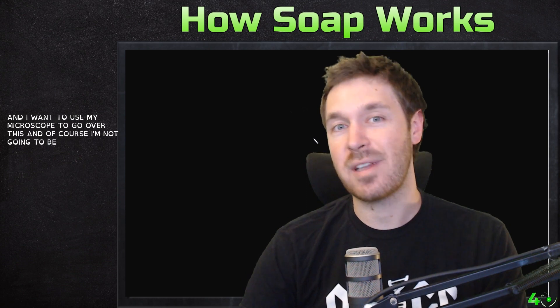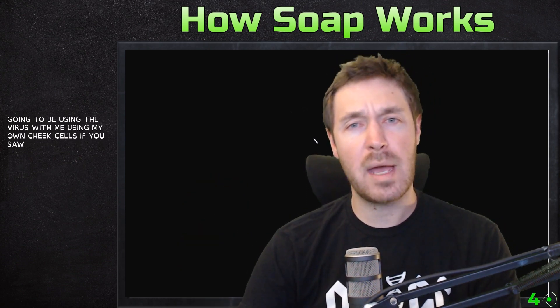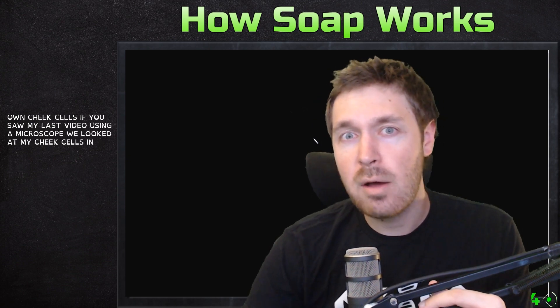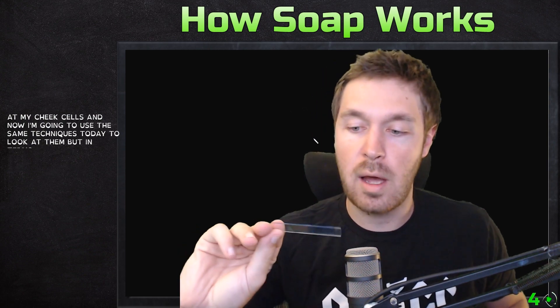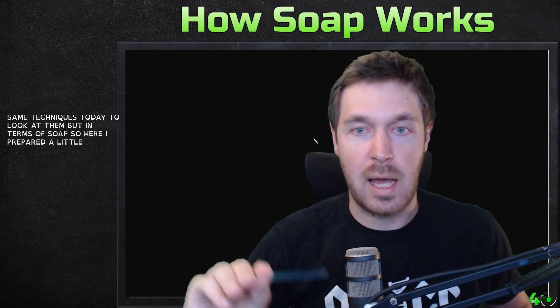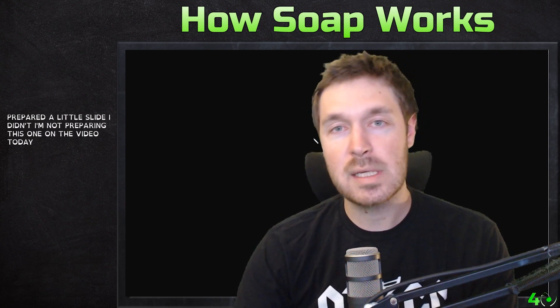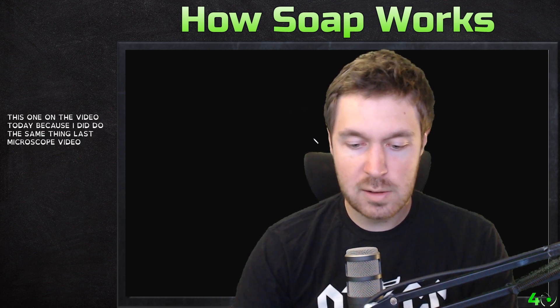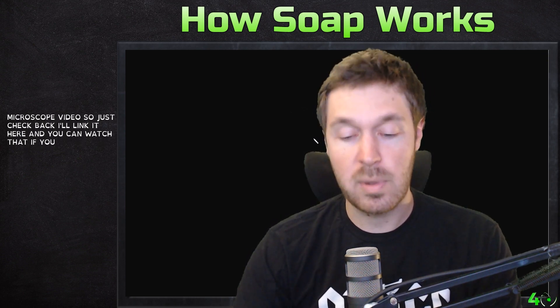And of course, I'm not going to be using the virus. I'm going to be using my own cheek cells. If you saw my last video using the microscope, we looked at my cheek cells and now I'm going to use the same techniques today to look at them, but in terms of soap. So here I prepared a little slide. I'm not preparing this one on the video today because I did do the same thing in the last microscope video, so just check back — I'll link it here.